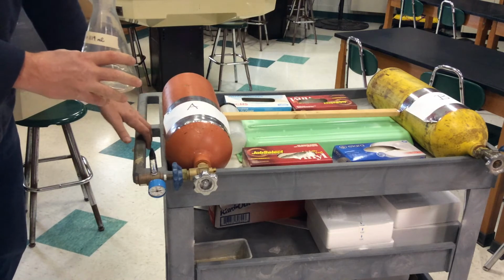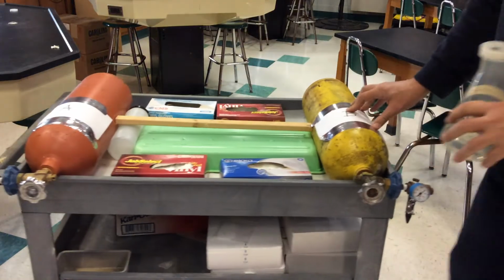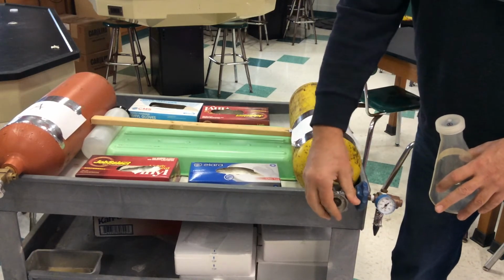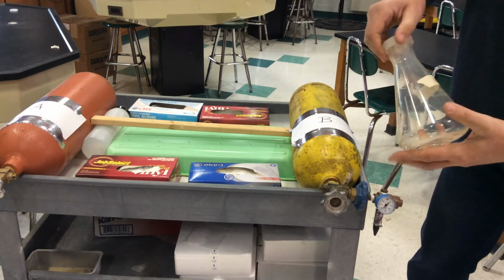Okay? Now, how would you do B? B's a little different. It's a little more dense than air. So we're going to notice its valve is pointing down. Of course, make sure it's open. And you can see the gas pressure gauge here. It's a Bourdon tube that we talked about. Now I'm just going to let this gas go, just showing you.